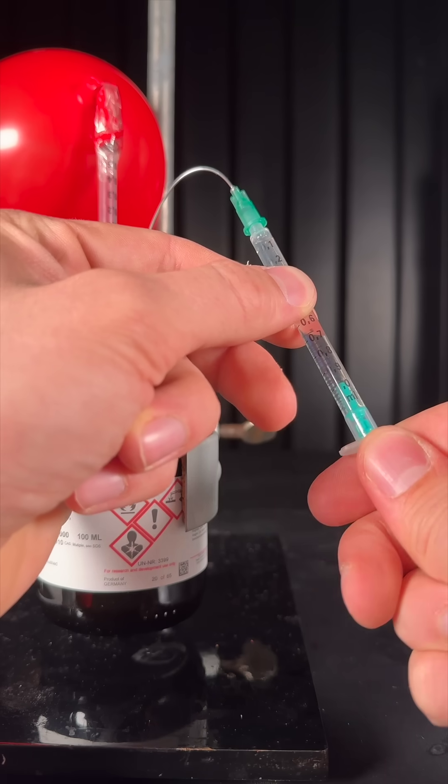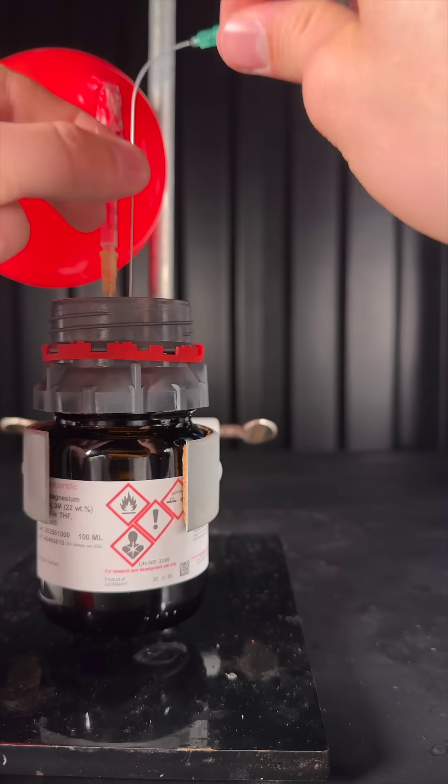To protect the reagent from air, I pulled out the needle a little bit and sucked in a layer of argon.